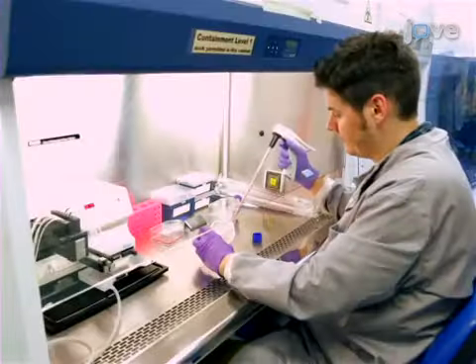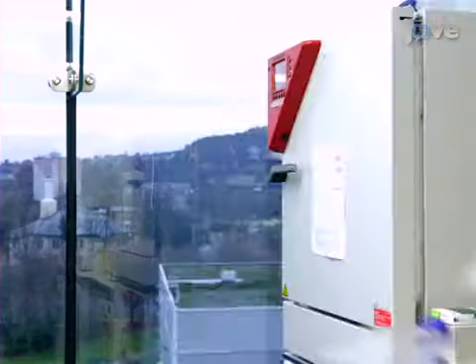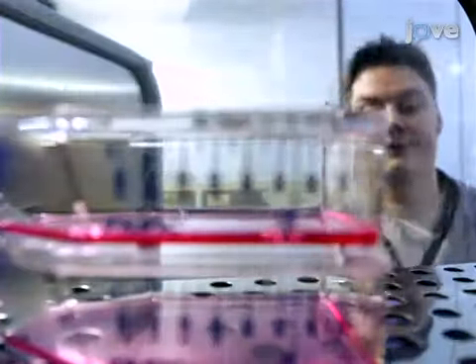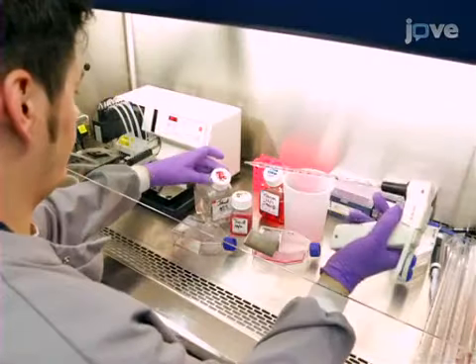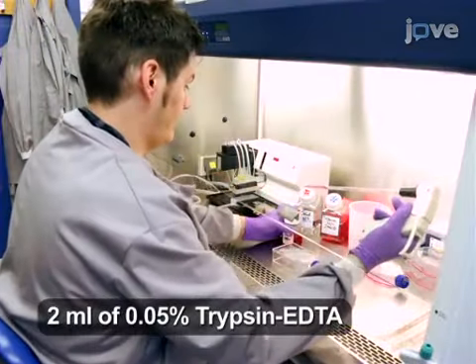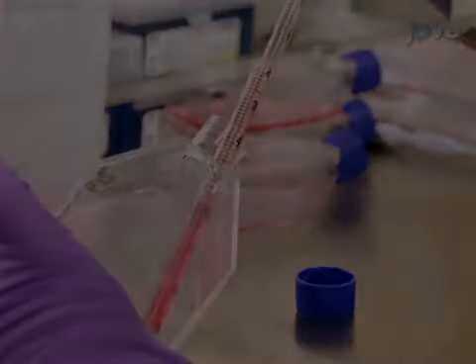To characterize the hypoxia responsiveness of the U2OS HRE reporter cell line, have ready two 75 cm square flasks of cells in DMEM with 10% FBS. When the cells are at 80 to 90% confluence, aspirate the media from one flask and wash those cells twice with 10 ml of PBS. Trypsinize the cells and resuspend them in 8 ml of DMEM with 10% FBS. Make the cells homogeneous with a pipette.